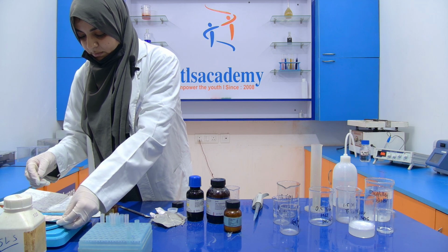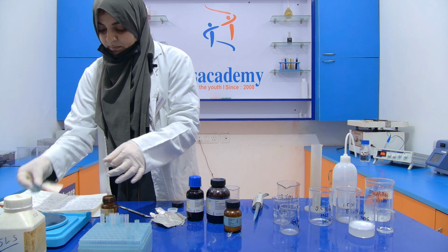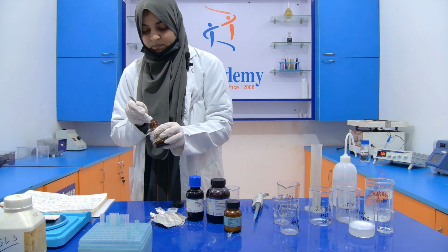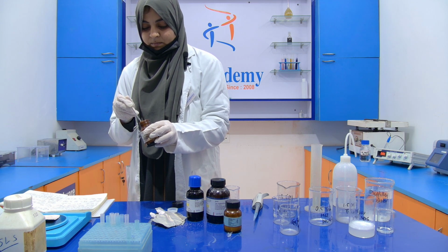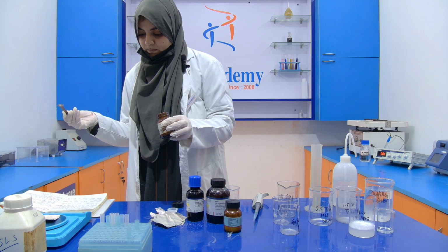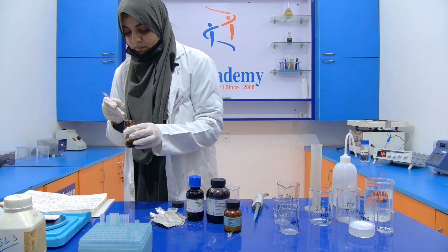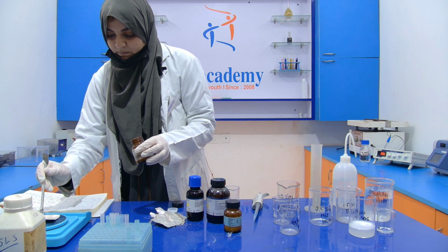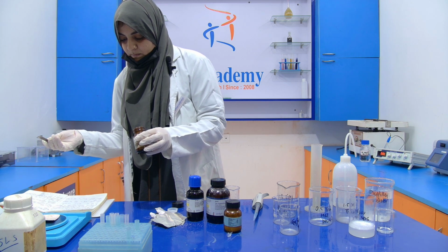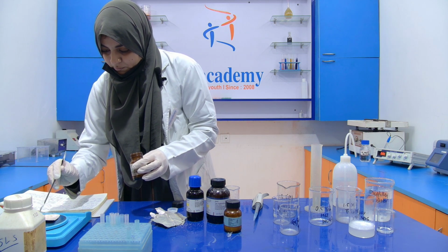Again, I'm going to take the weight because it is not correct. 0.03, and a little amount is required.